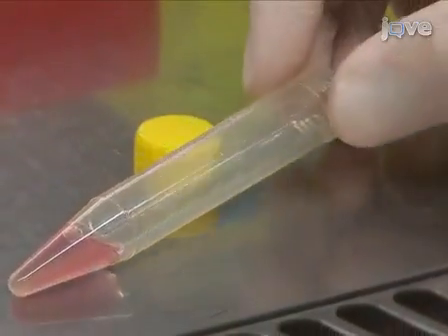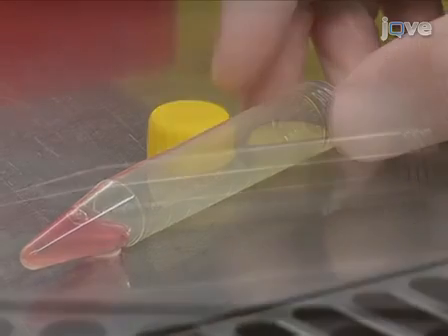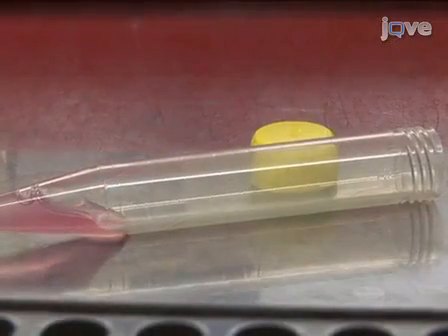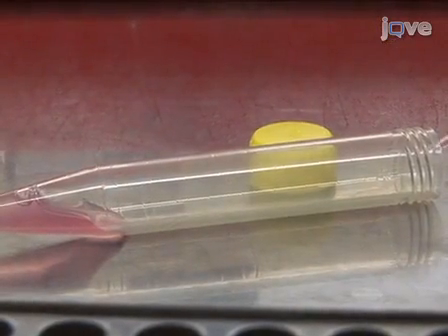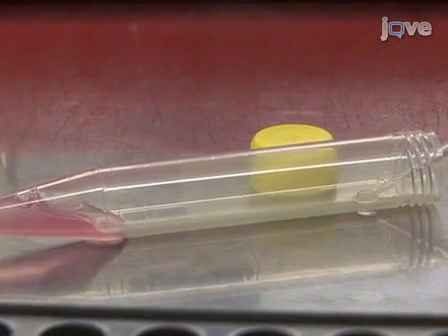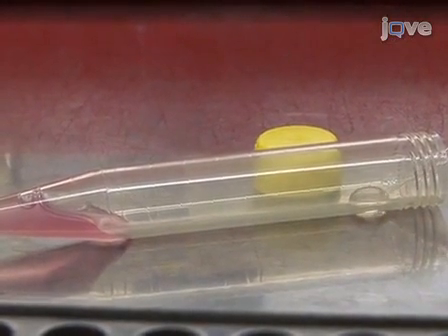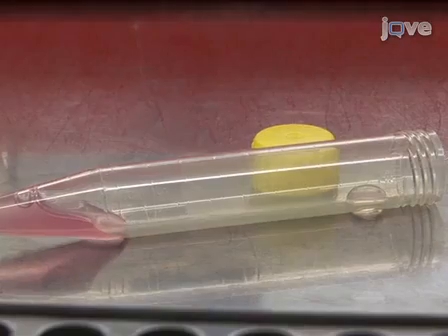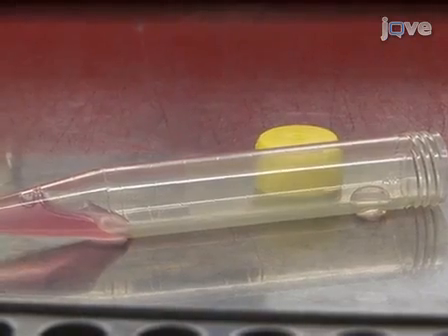Lay the tube horizontally. Carefully add 110 microliters of PBS to the top of the tube in the non-wetted portion of the plastic, ensuring it does not make contact with the cell solution.